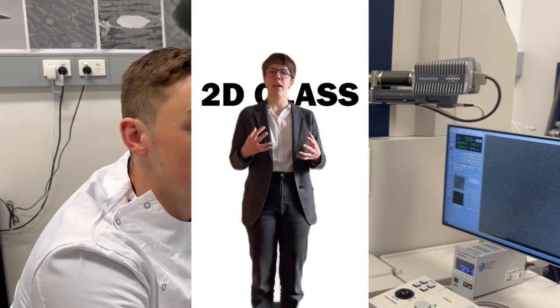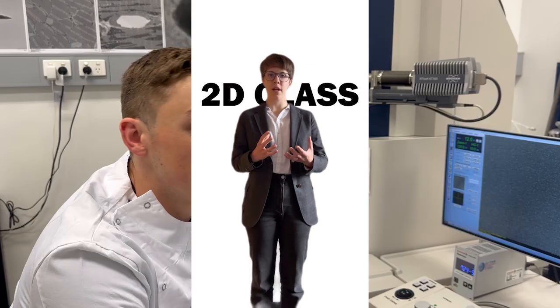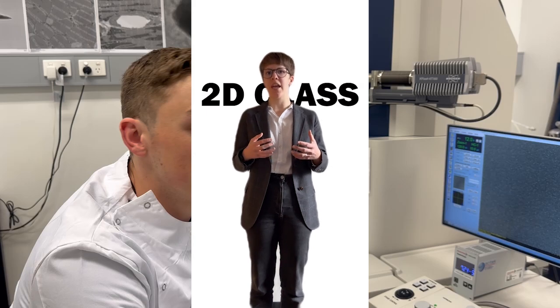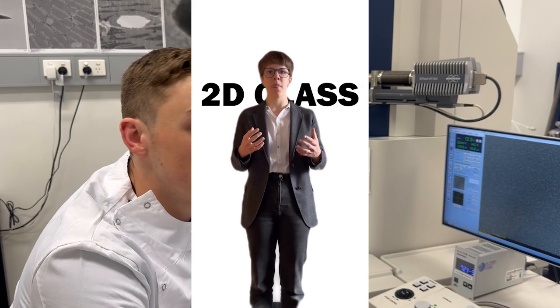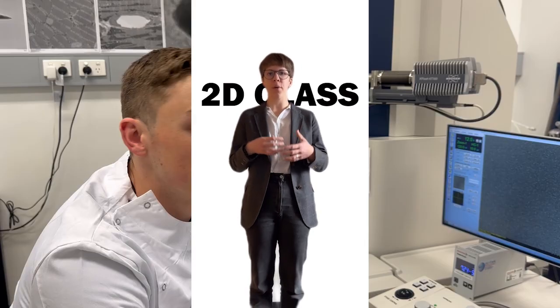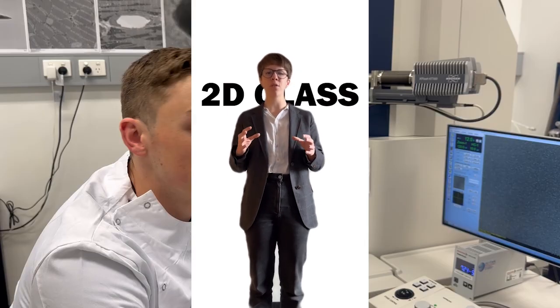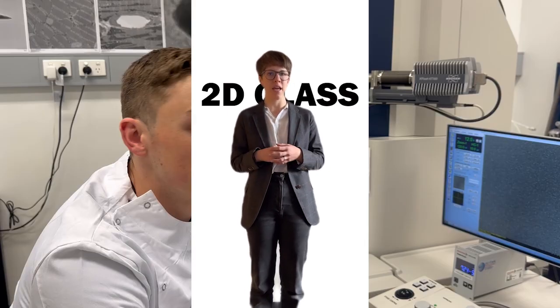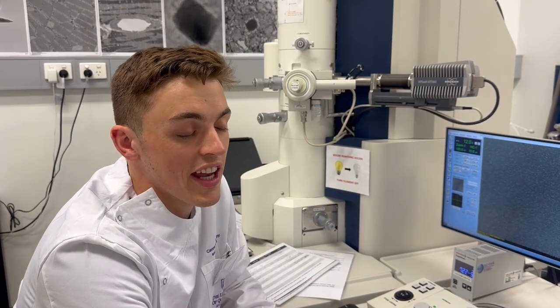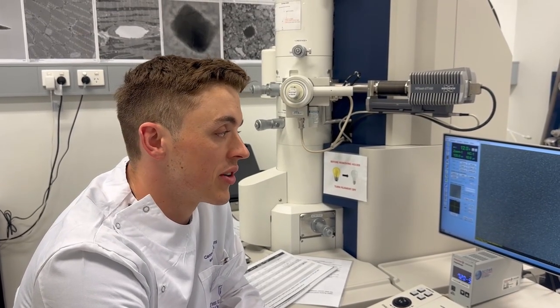The vaccine candidate proteins are a three-dimensional object. When we shoot a beam of electrons at them, what we get is a two-dimensional shadow of the vaccine candidate at a particular orientation. When we average thousands of these shadows and put them together, we get a 2D class, which gives us a good idea of the shape of our vaccine candidate protein. And that gives you a better indication of how the protein is looking.